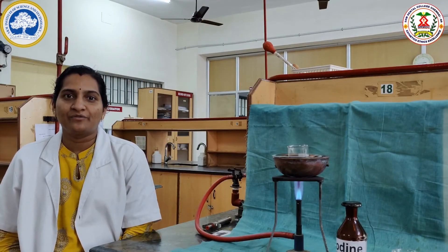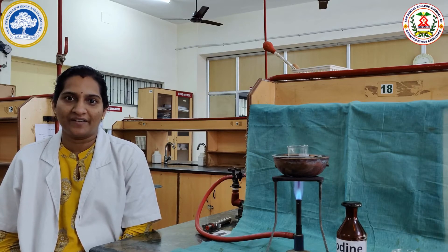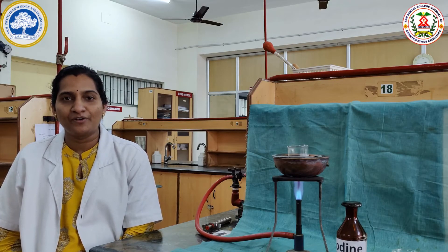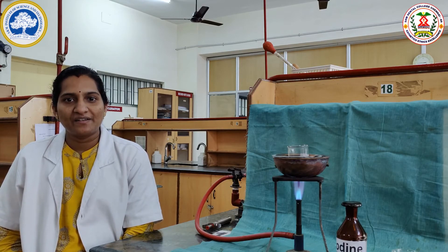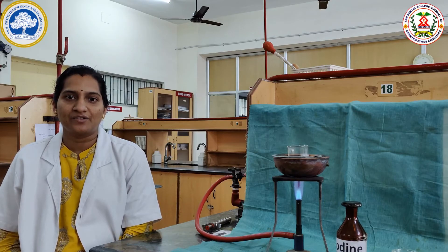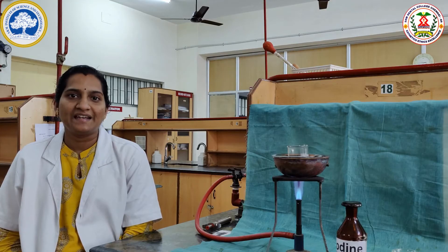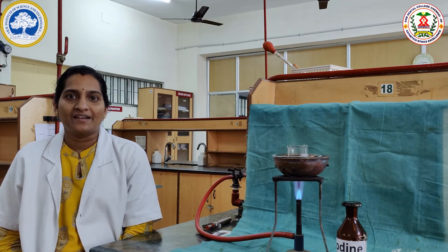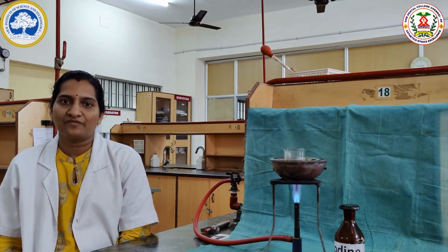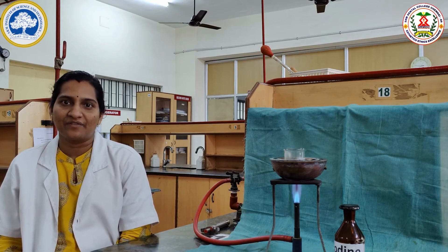With the preliminary tests, we conclude that starch is a polysaccharide and a non-reducing carbohydrate. On hydrolysis with HCl, starch will finally form glucose. The course of hydrolysis is periodically tested with iodine solution, which shows the formation of various dextrins, each giving different colours. After complete hydrolysis, Benedict's and Seliwanoff's tests confirm that starch is formed of only glucose.